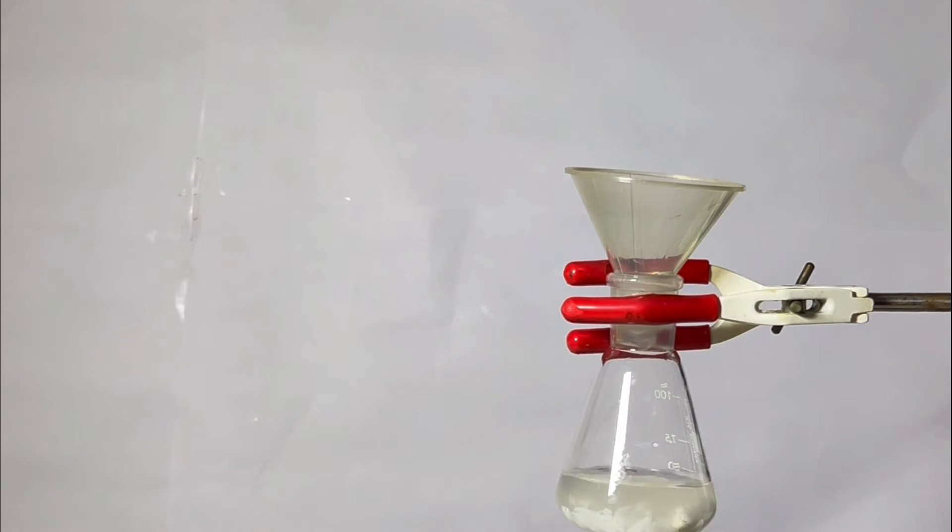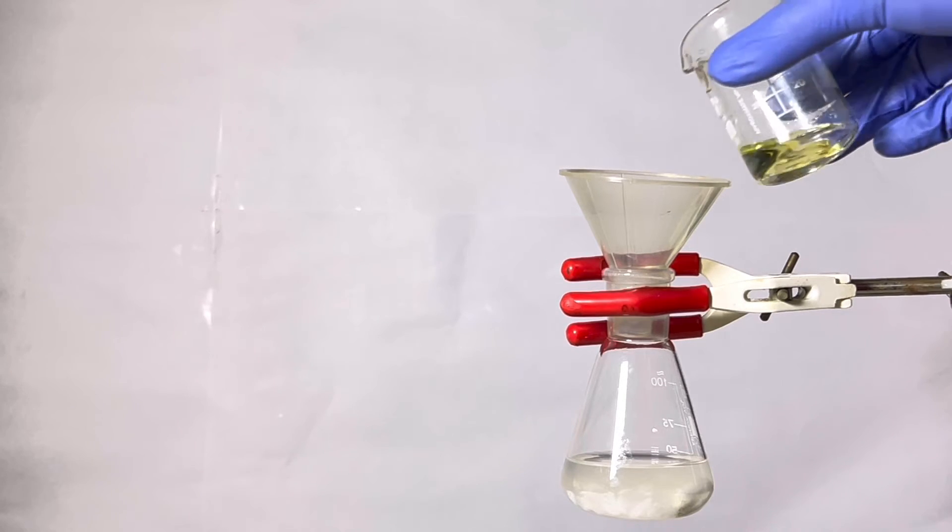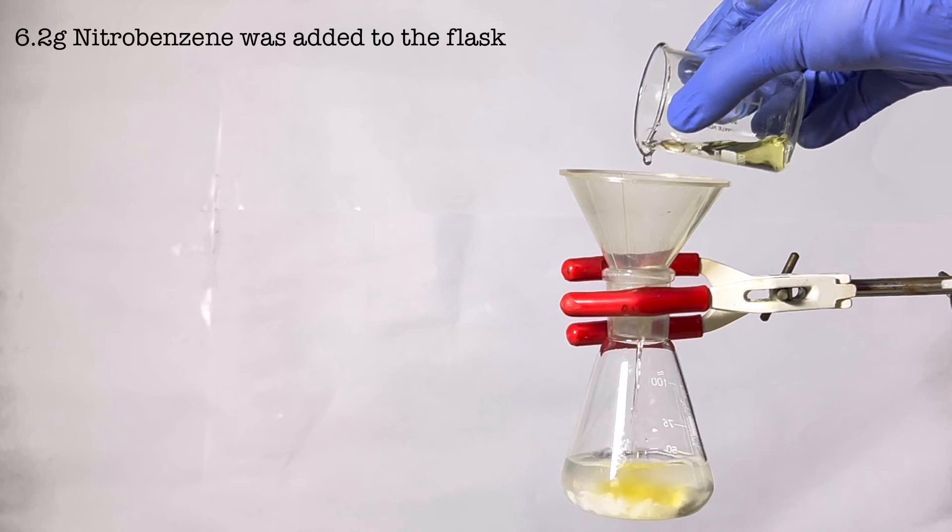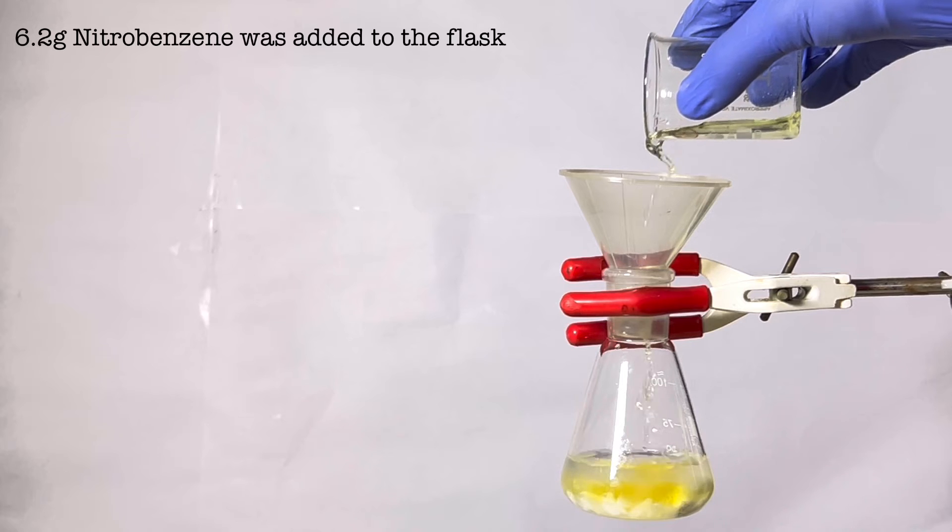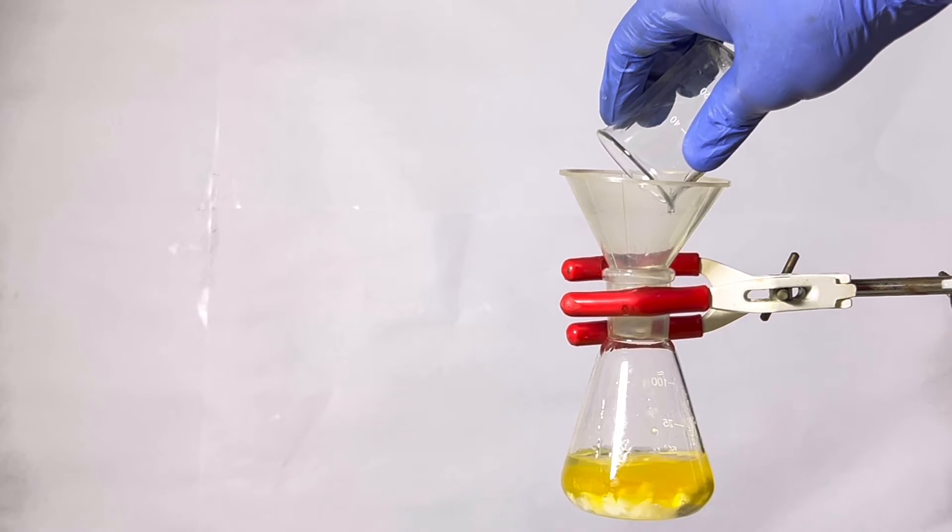Next, 6.2 grams of nitrobenzene was added to the flask. Nitrobenzene is a distinct light yellow color and is extremely aromatic.